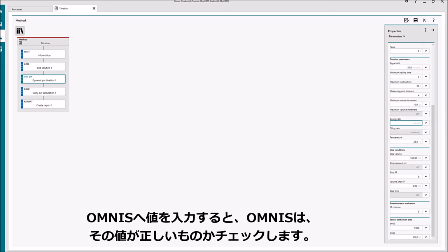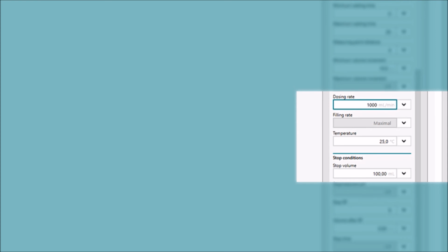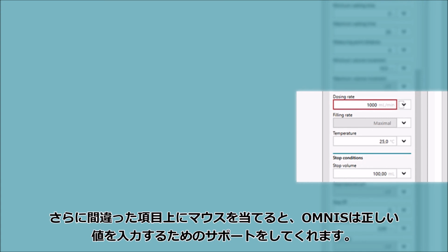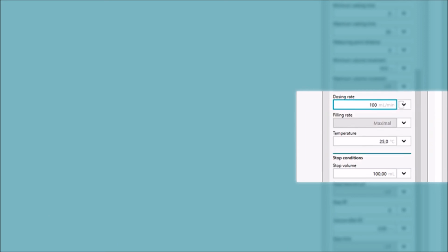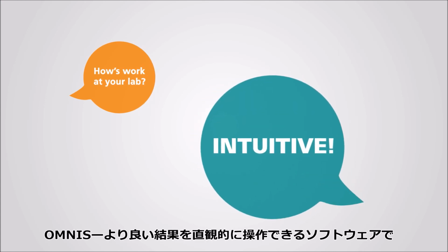When entering data on the OMNIS user interface, OMNIS checks the validity of your input. OMNIS actually warns you if your input fails this check. Even better, move your mouse over the field in question and OMNIS helps you to enter valid data. OMNIS, intuitive software for better results.